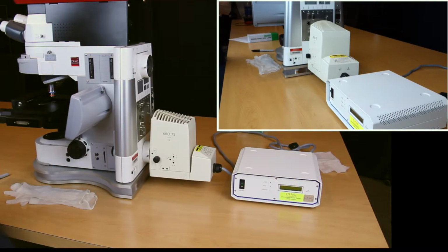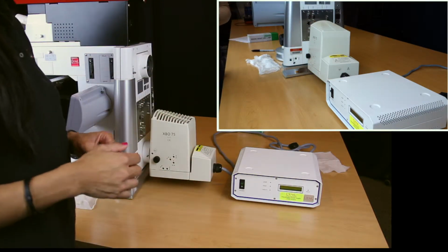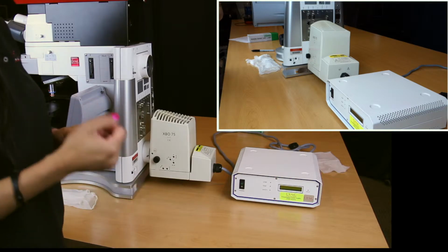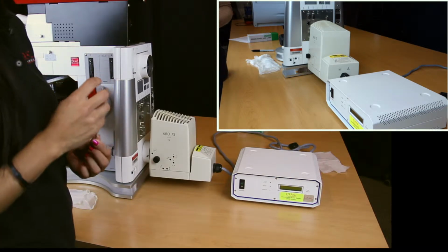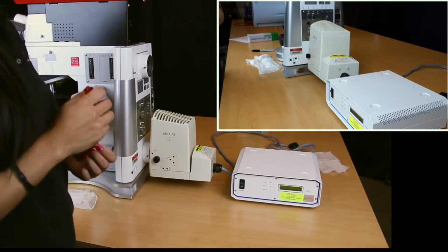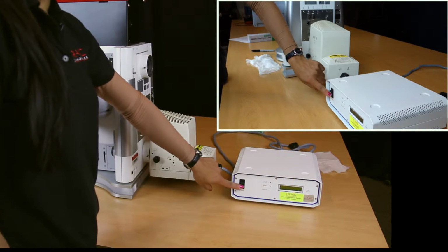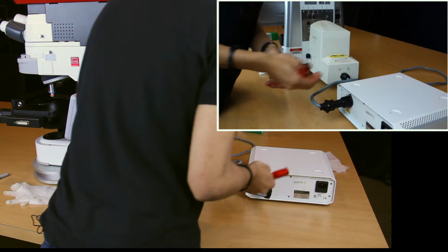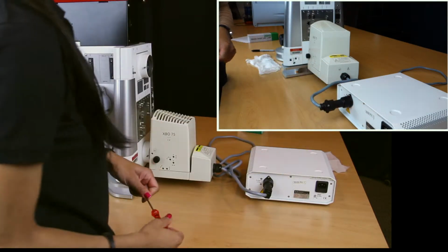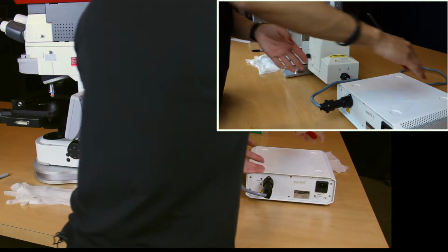So this is the right-hand side of your microspectrophotometer. You have your transmission lamp housing as well as your transmission power supply box. In order to ensure some safety, you always have to make sure that the system has been properly shut off for at least 30 minutes, if not an hour, so you can allow the system to cool down. So what you want to do is go ahead and shut off your power supply. And for additional safety, go ahead and remove the power cord from behind the unit. For demonstration purposes, the unit's actually not plugged in, so there's no power cord here.